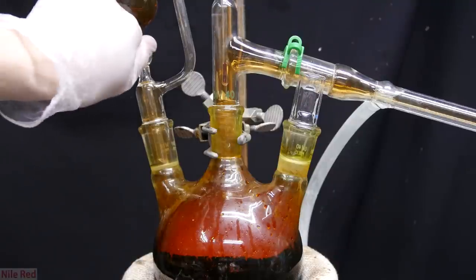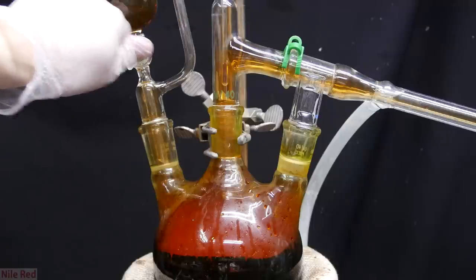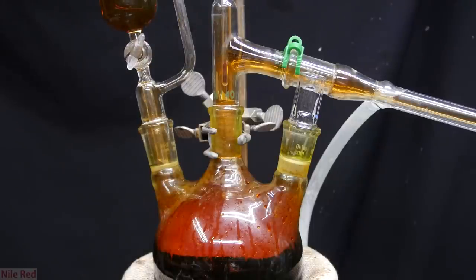My goal is to use the manganese dioxide in another over-the-counter synthesis of bromine. By heating a mixture of manganese dioxide, sodium bromide, and sulfuric acid we can generate bromine.